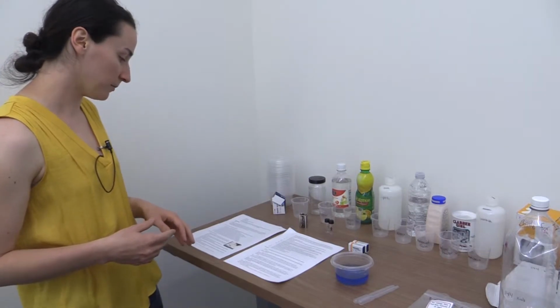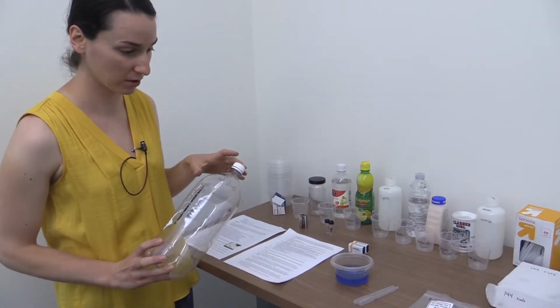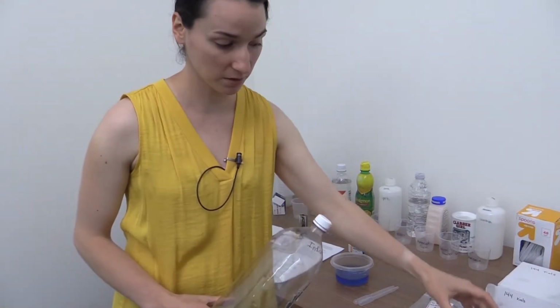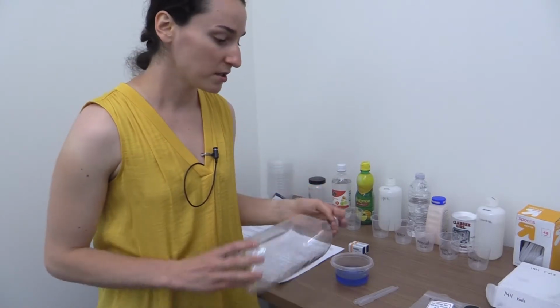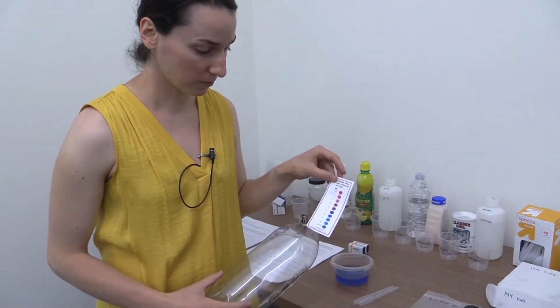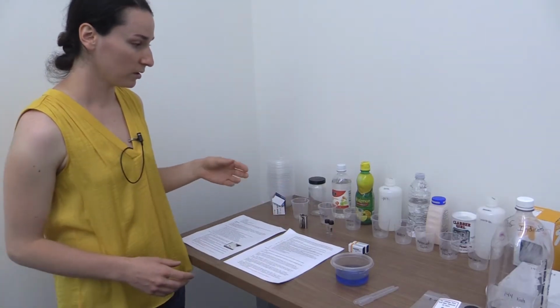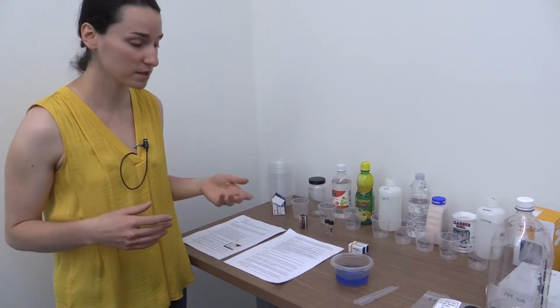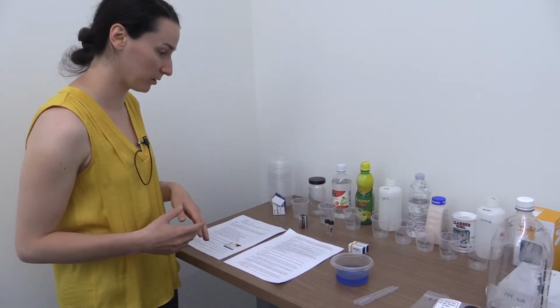I glossed over this, but you're going to prepare this bottle full of cabbage juice indicator before you start teaching the class, and it's just 8 to 10 scoops of the red cabbage juice indicator, and then you fill it preferably with DI water so that you can have a nice range of pH indicator solution, and the pHs are indicated by the colors there. I would have them guess whether the chemical was going to be an acid or a base before they actually got the chemical back to their workstation. That way it engaged them a little bit more while we were setting up and preparing for it.